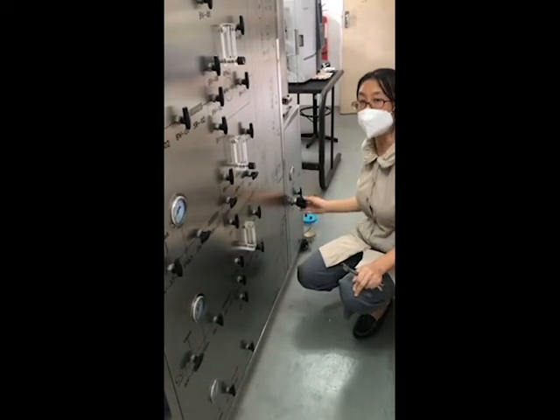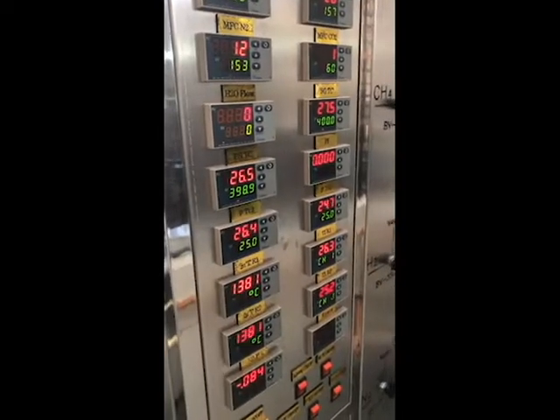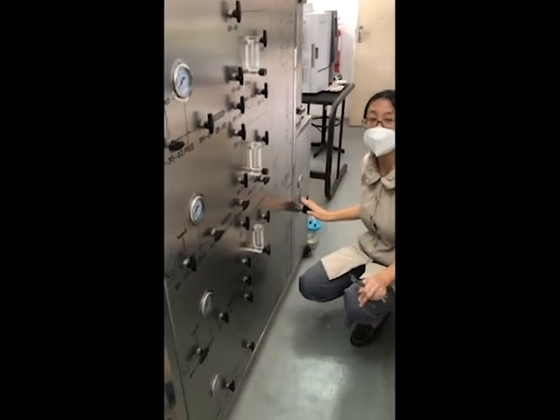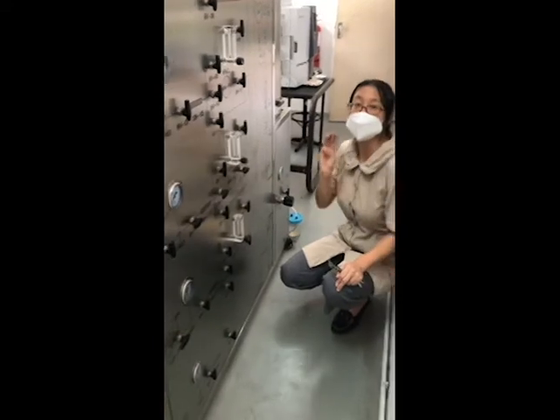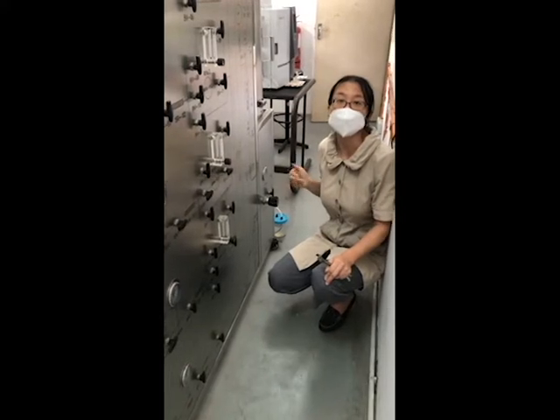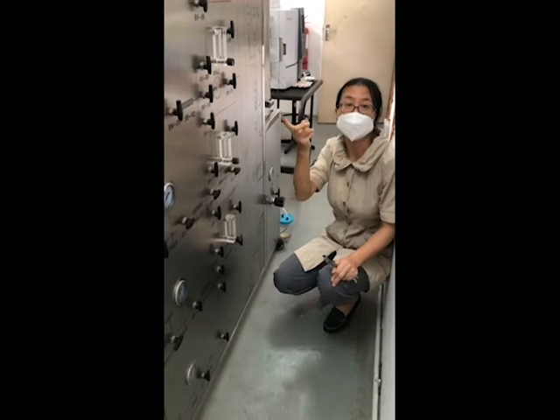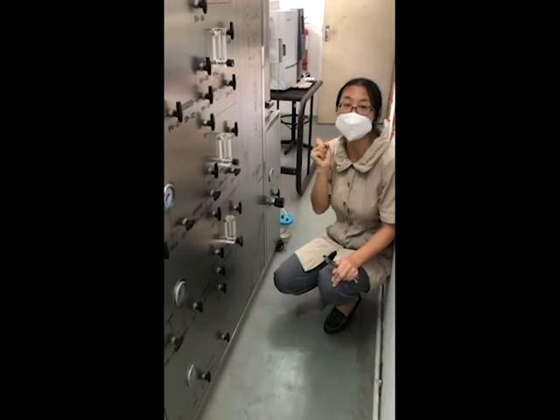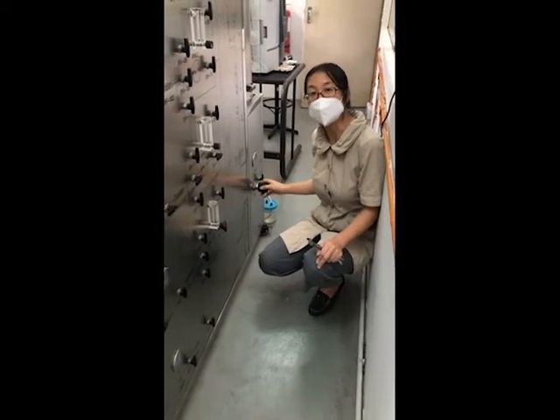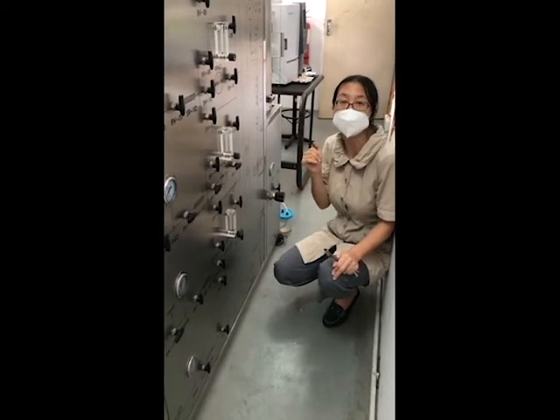And when you open it slightly bigger, if the pressure drops down, that means there is not enough pressure outside. You check again. So flow, pressure, and continuous bubbling: these three need to be balanced with each other. You need to practice this a little bit. How much gas source pressure you need to set, how high the flow, and how far to open here. When these three balance each other, you will get a perfect result.